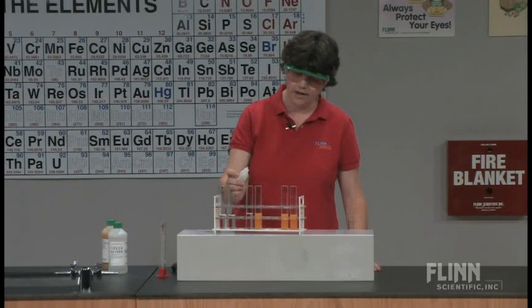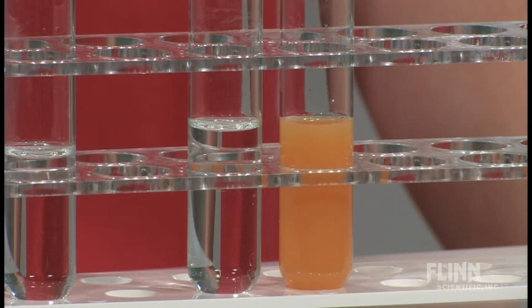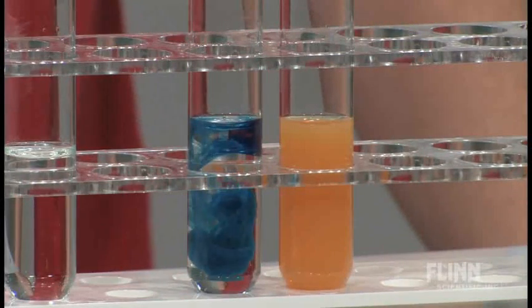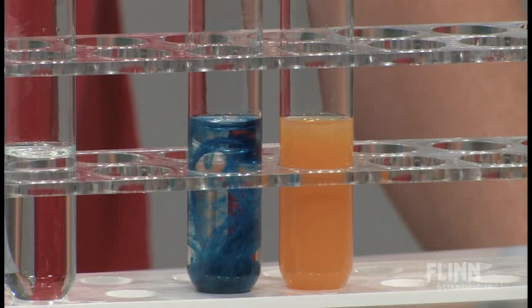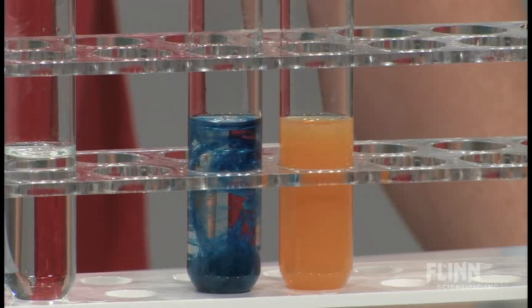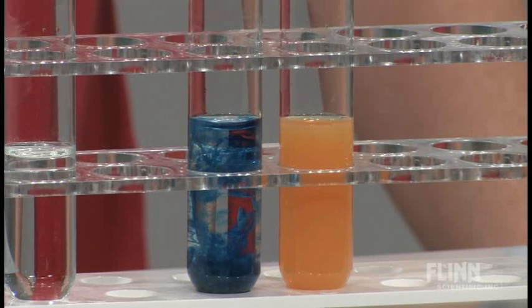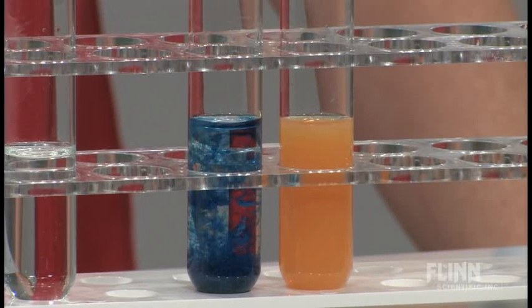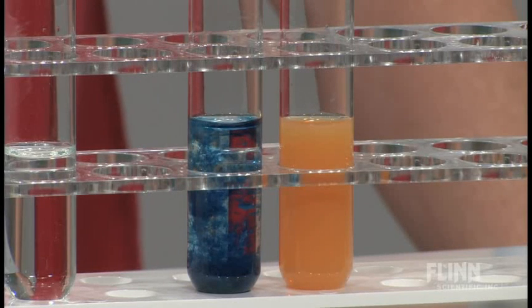This is two plus ion, one, two, three, four, five. I'm getting kind of a blue there. And that blue precipitate is the iron hexacyanide complex ion.